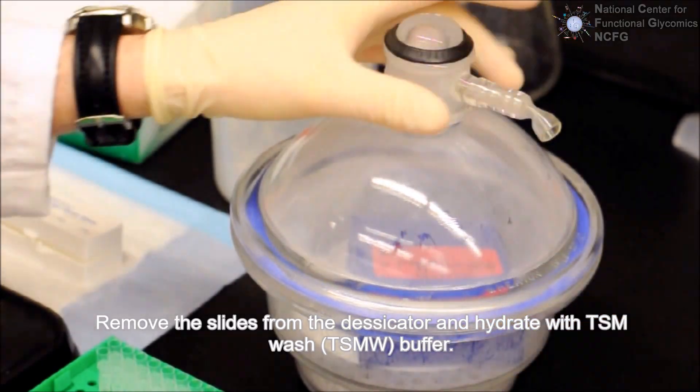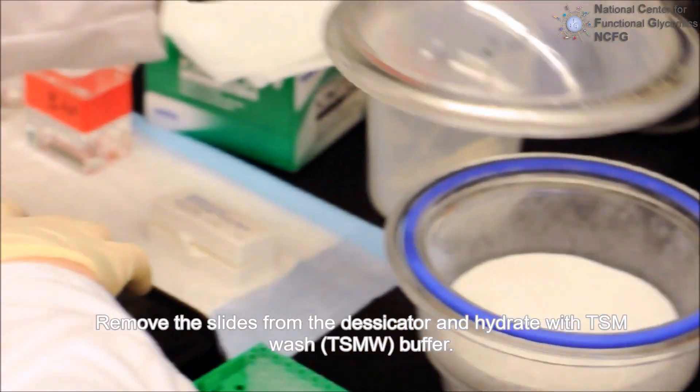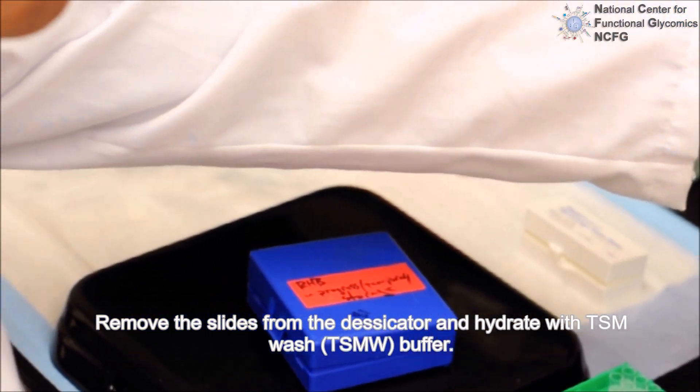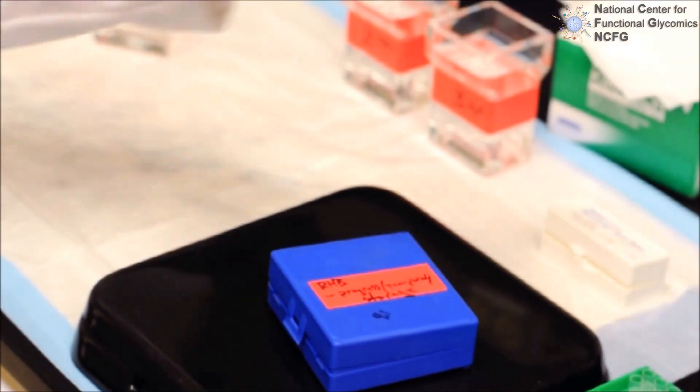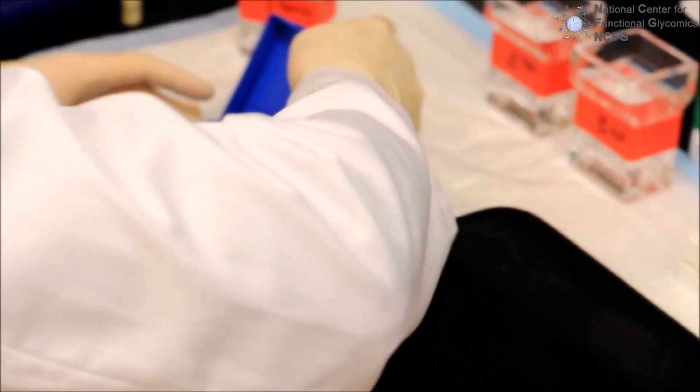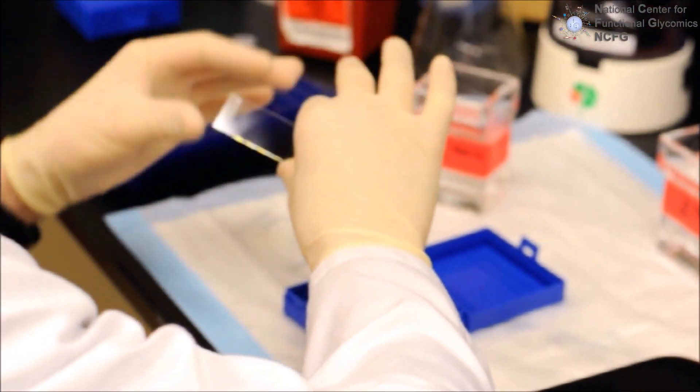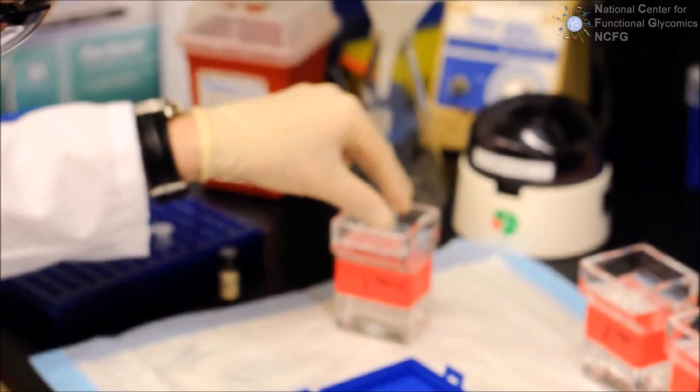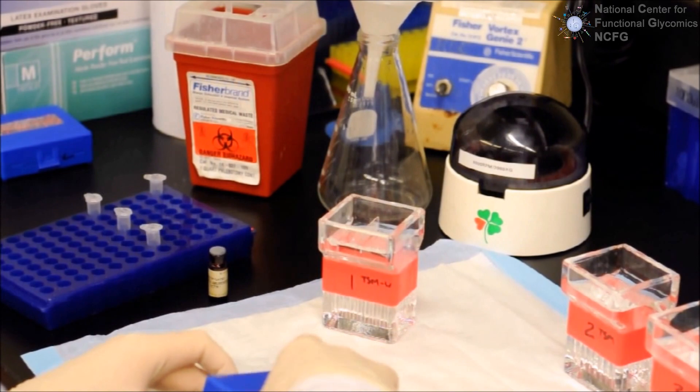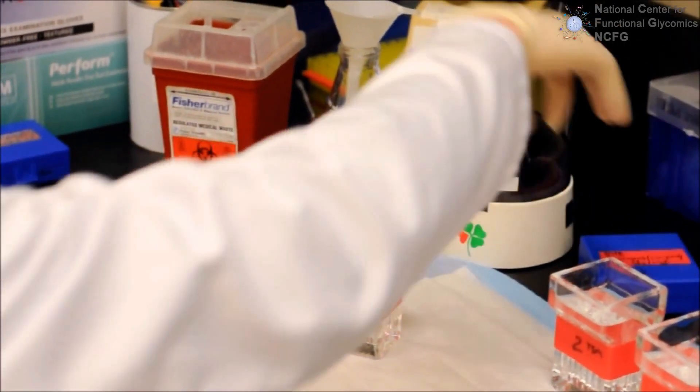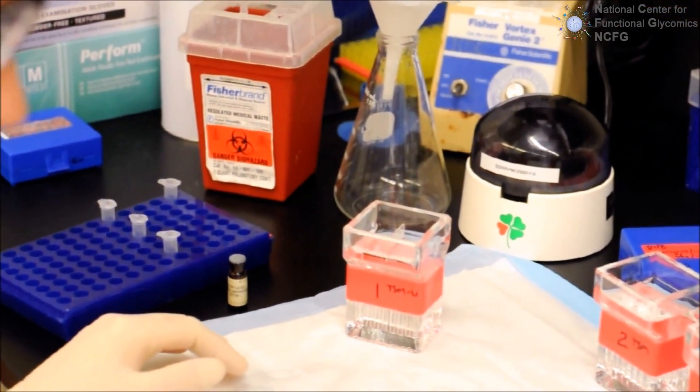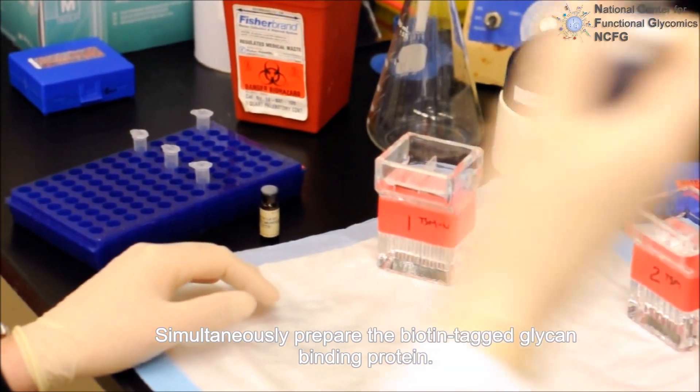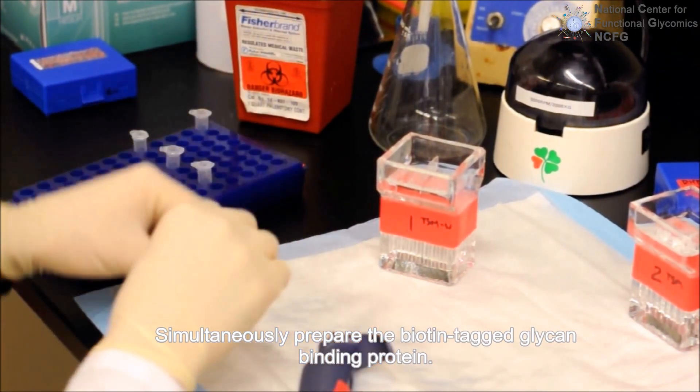Remove the slide from the desiccator and rehydrate with TSM wash buffer. While the slides are rehydrating, prepare the glycan binding protein and TSM binding buffer.